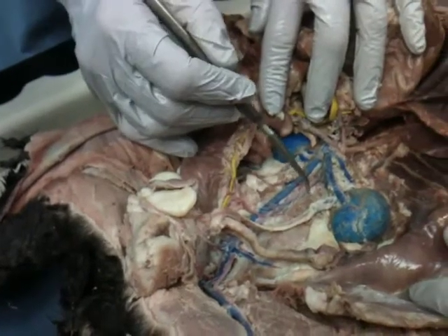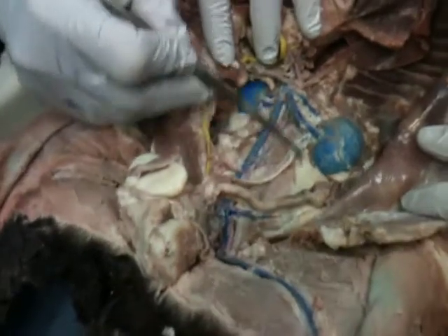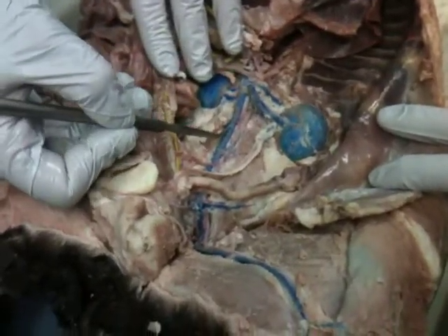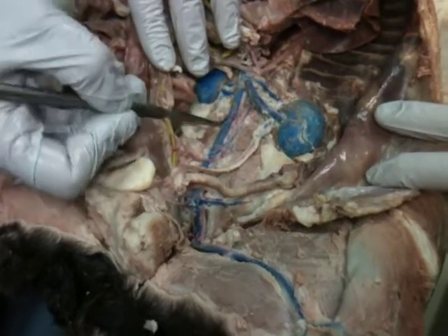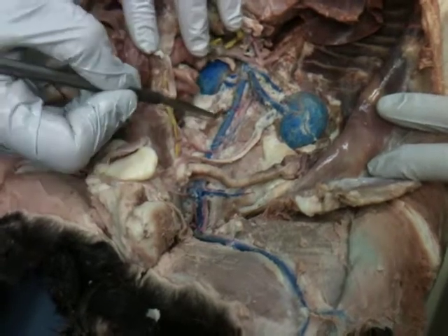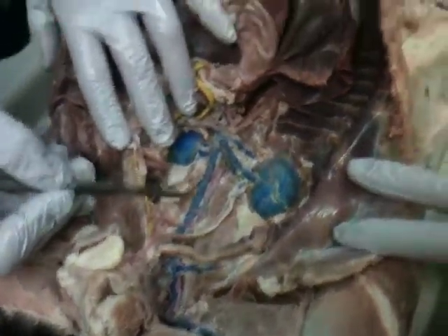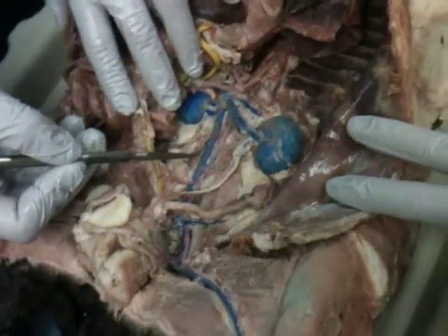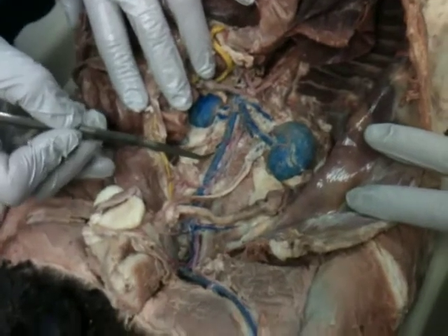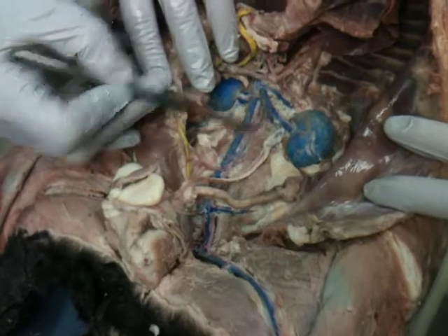In a male, you'll see it as left spermatic vein. So there are different names for it. But the left one comes off here. It's kind of interesting, whereas the right one comes somewhere directly off or into the inferior vena cava. It might have been this guy. I'm not sure. Sometimes you need to follow it out to see where it goes to be able to fully identify it. Is that in all cats? Yes. Okay. And so humans, right side also? Correct. Cool. Yeah, so the right goes directly into the inferior vena cava, and the left is into the renal. Good.